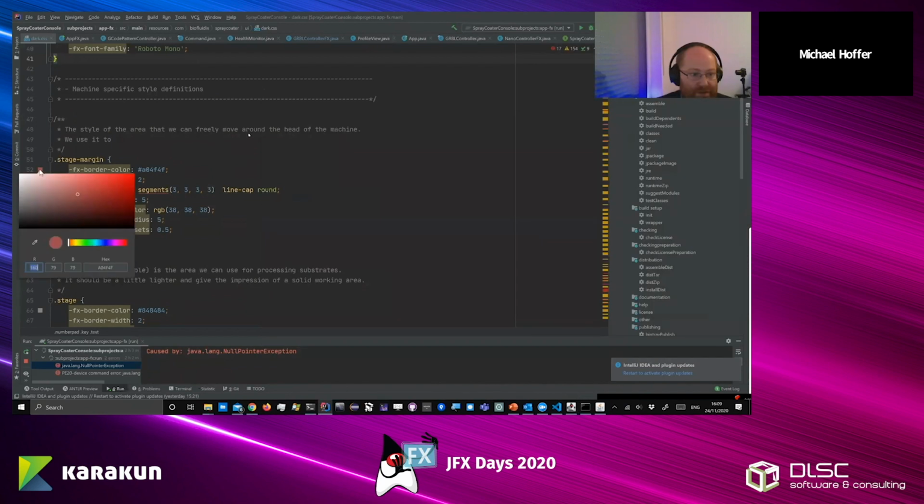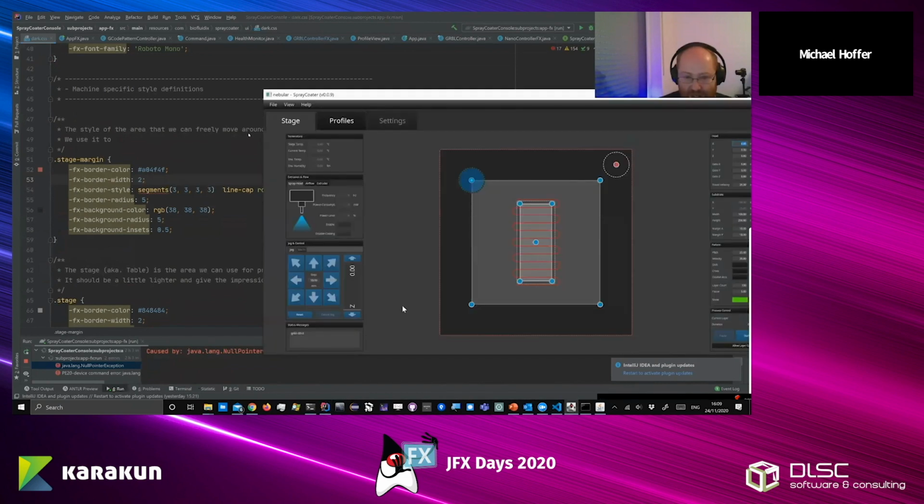You just specify your border color, the width, and then if you have some dash lines like we have here, you specify them, and border radius if you want that. And in this case, you don't have to forget the background radius.